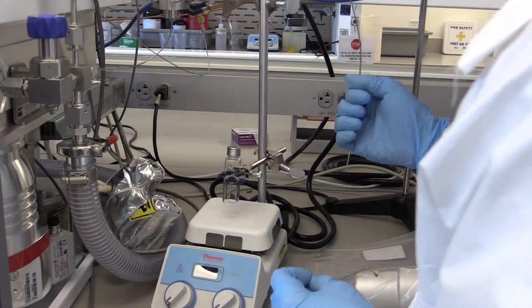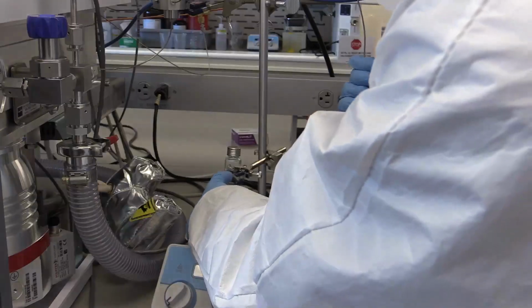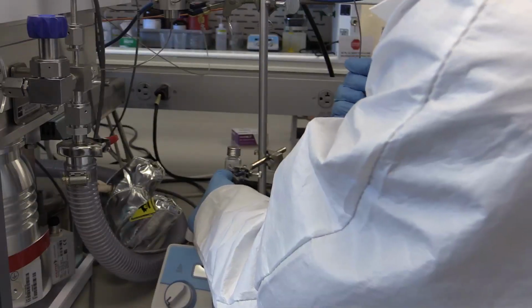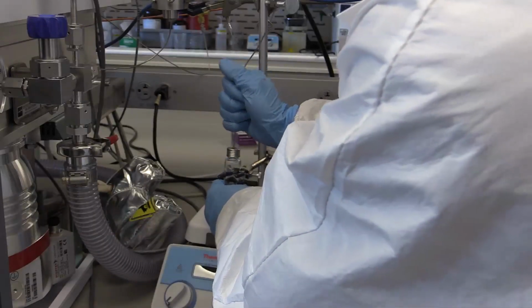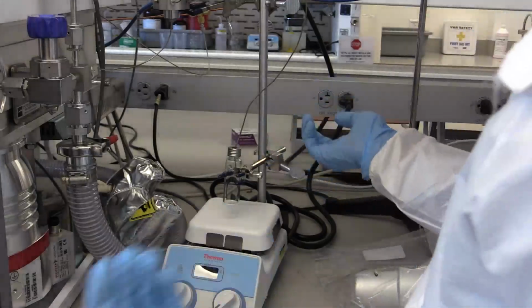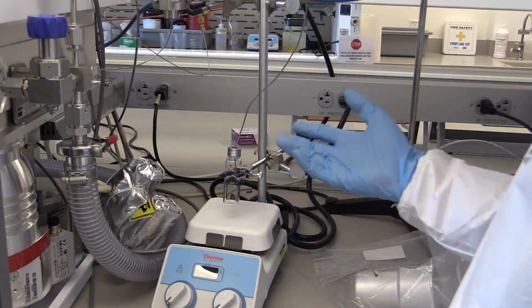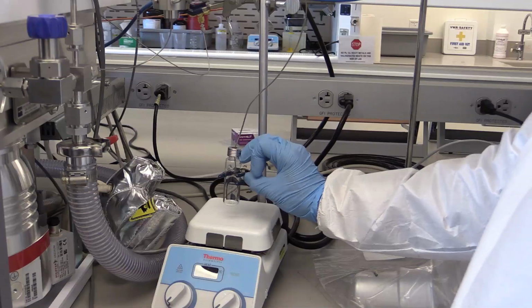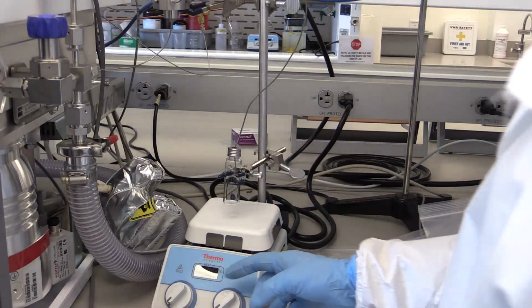And again, it's really important to note that depending on how high your solution height is, you only want to sample the headspace. So we basically punctured the septa just like that, and we'd sample the headspace for a couple minutes, analyzing what the composition of that gas, or of that headspace is, the gas composition.